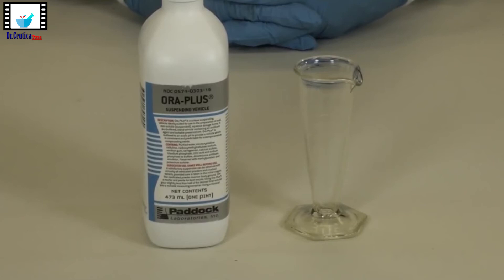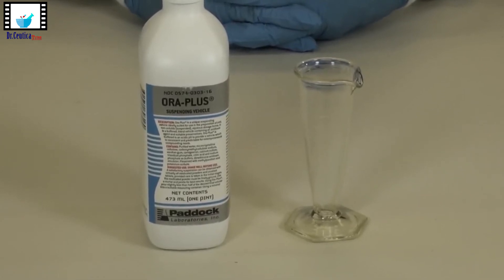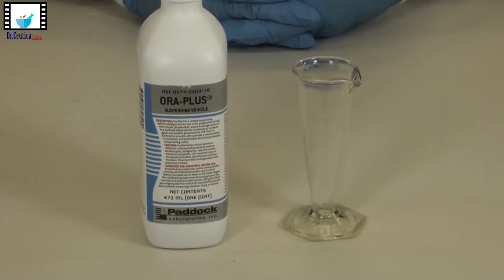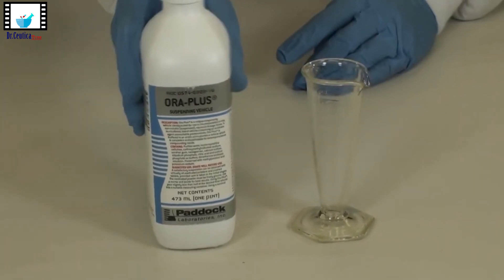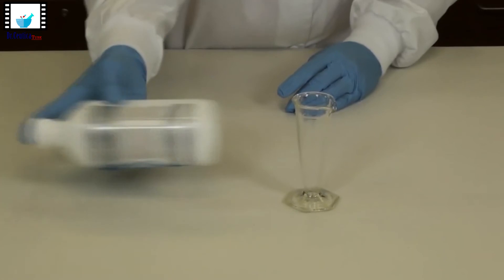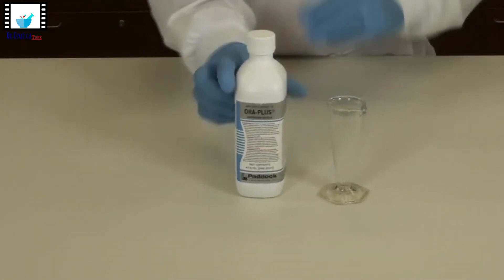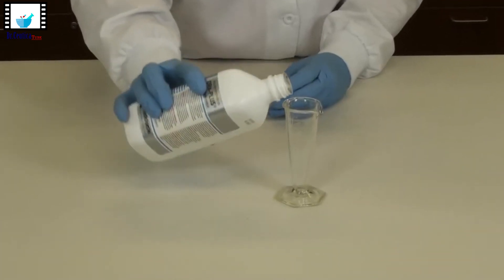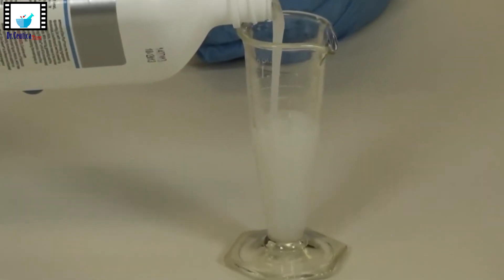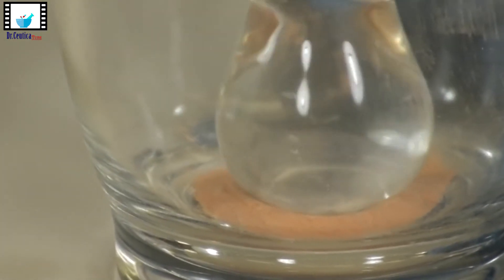We then move to the next step — adding the liquid components. This is a bit different from the earlier steps: usually we said to pre-measure the liquids before starting, but here we measure the liquid while working. That's okay — there are lots of schools to follow in pharmaceutics compounding. As long as your final preparation is well compounded, it doesn't matter much which procedure you followed.